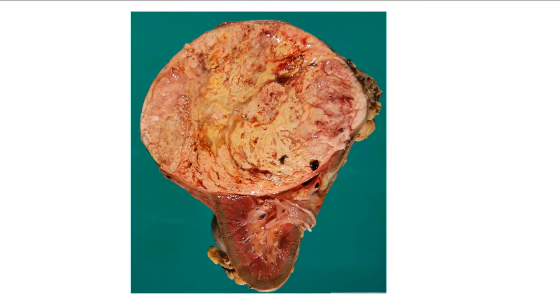So there's a nephrectomy, such as the one that you're seeing in the photograph here. Sent to pathology. Sections will be taken so that the pathologist can look at it under the microscope and make a diagnosis, not just of the fact that it is a renal cell carcinoma, but to see what subtype it is, and to tell us other things about the tumor that we report for malignant tumors in general. So, how should this tumor be sent to the lab?